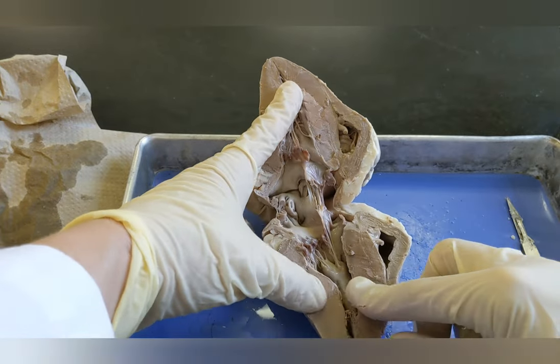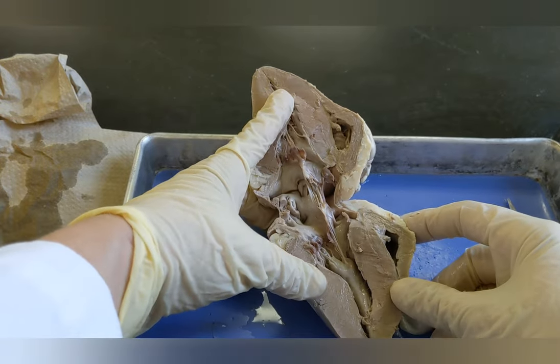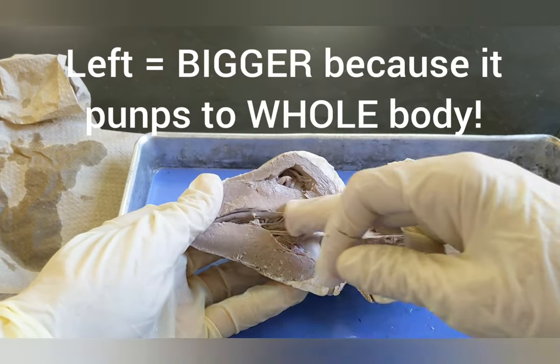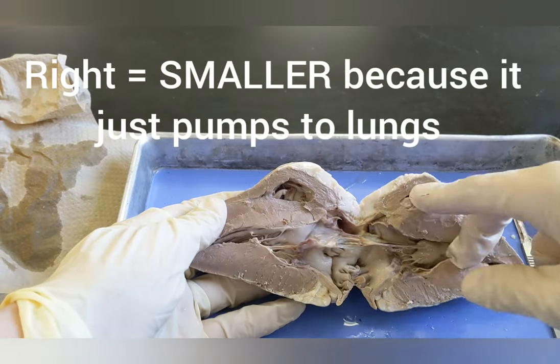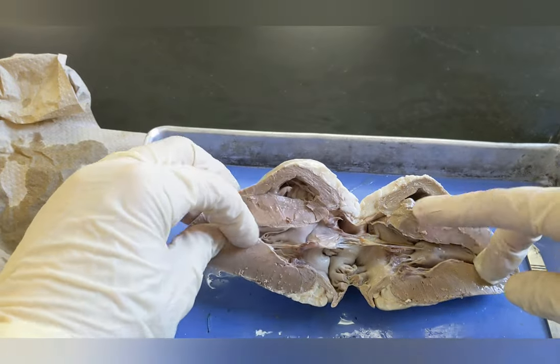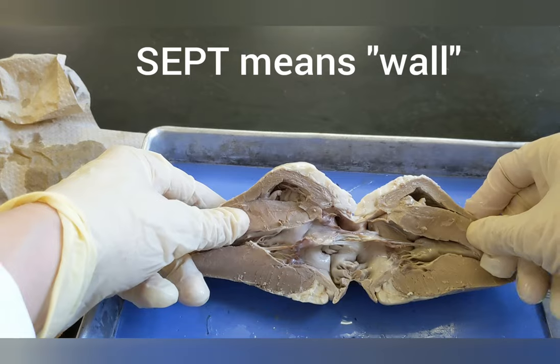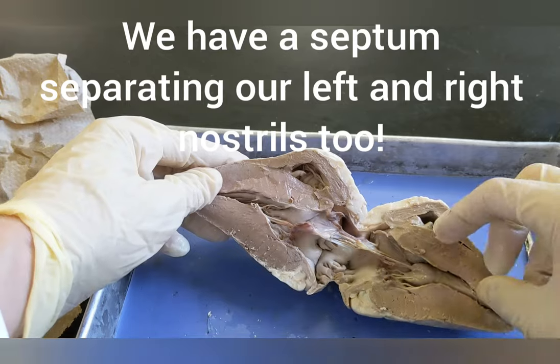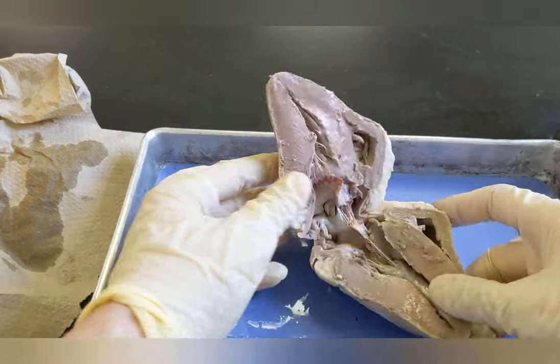You need to identify the left and the right side of the heart. The left is the big side — it's always easy to tell. Even if I couldn't see the front of this heart, I would know just by looking: the left is the huge side, and the left is going to be on both the front and the back. The right is the small side, and it's going to be on both the front and the back. This is all right, this is all left, which means this big wall between the two sides is the septum. The septum is actually very thick, and it's there to keep the right and the left side separate, but it's also very muscular to help pump blood out through the ventricles.